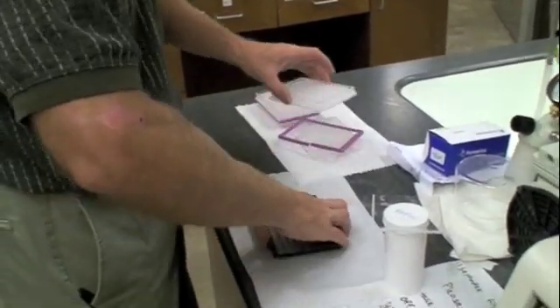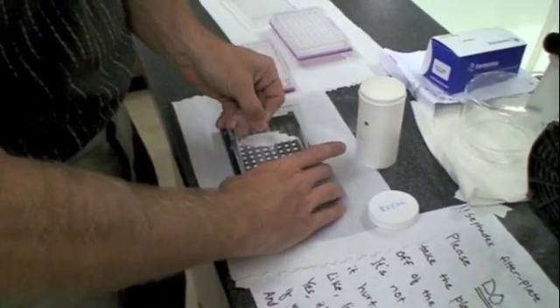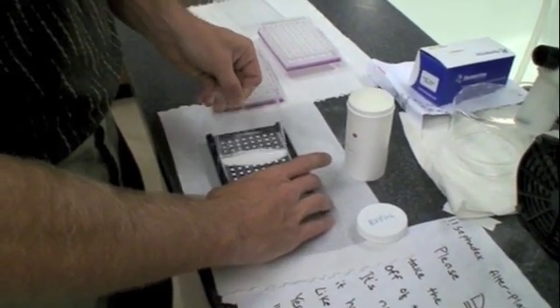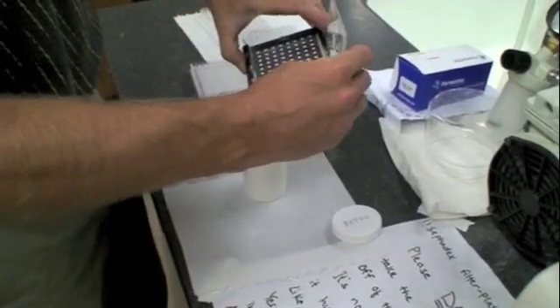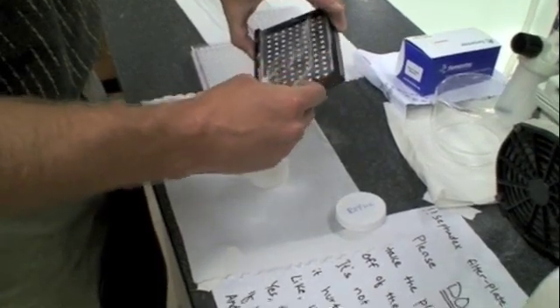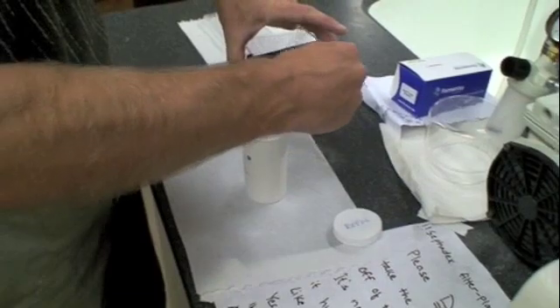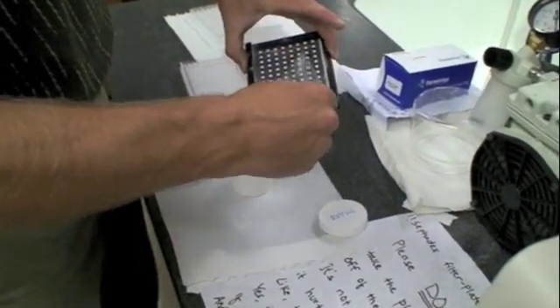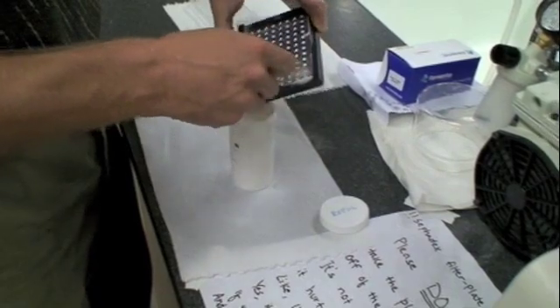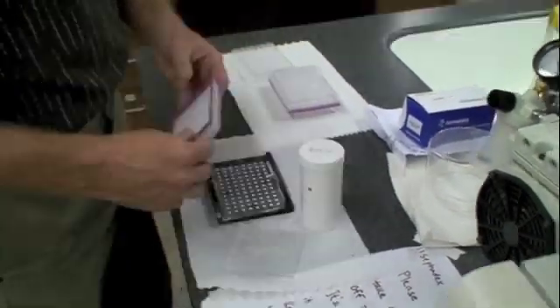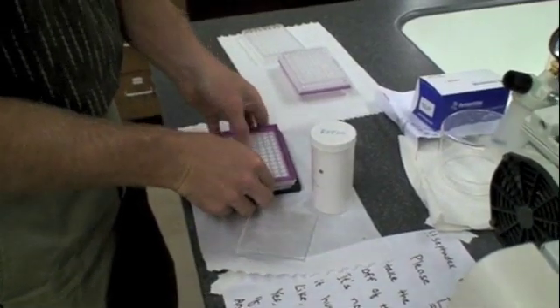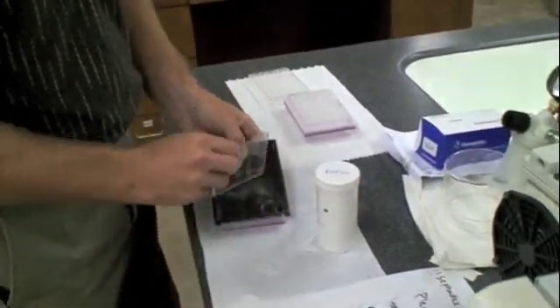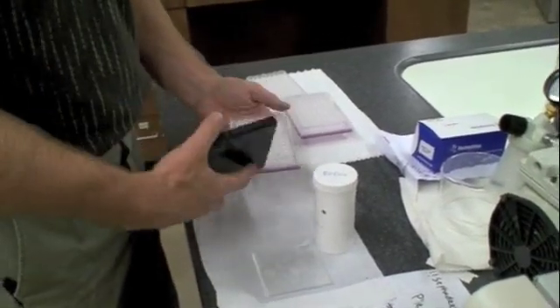Now we need to do plate two. See how all the wells are full. If some of them aren't full, I just move the pile back and forth. I don't want to tip this bottom of this black plate too much because Sephadex will start sliding out. So I try and keep it kind of flat and scrape back what I can. A whole plate is a little... I'm not particularly talented at this. A whole plate is more complicated than just the eight wells. If you just do eight, it's a lot easier. Flip it over, put it against the peg, lift up the metal form, tap a little bit of Sephadex out. Put this on a catch plate.